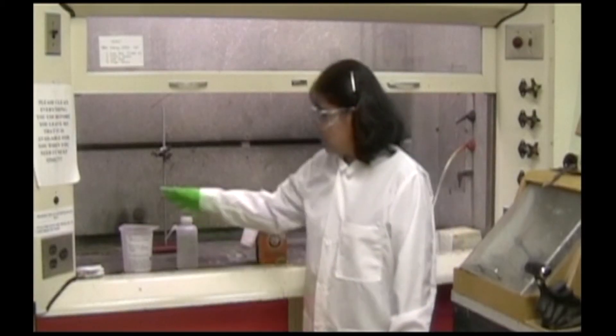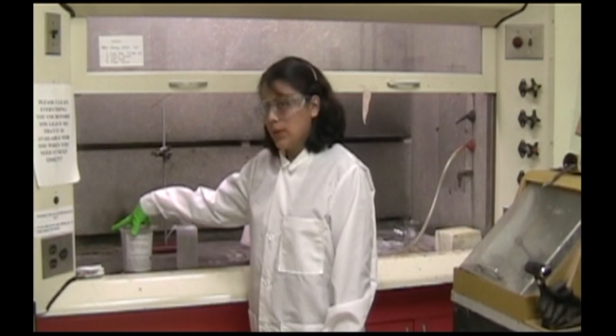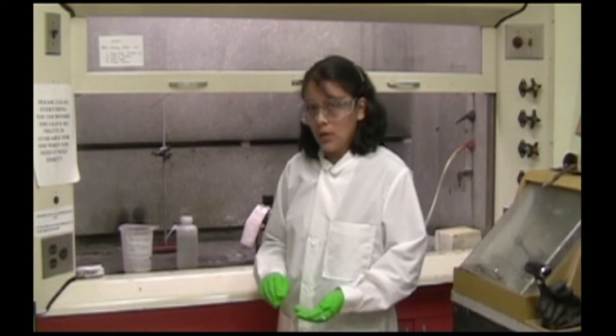Once you're finished, be sure not to forget to rinse out the waste effluent container and to throw away any Q-tips you have used.